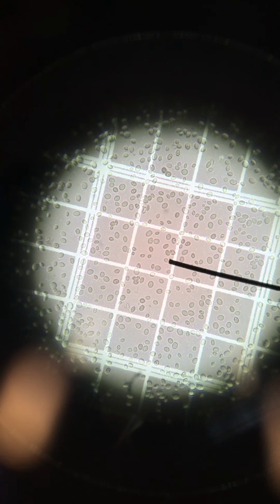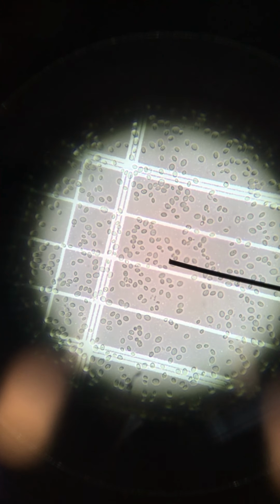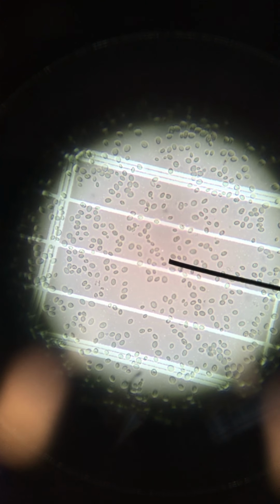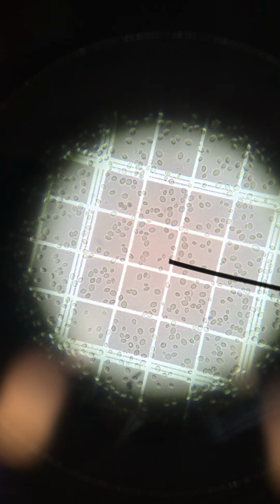So we would simply go through this cell, count up all of them, and then you would move across your field of view until you get to the opposite cell. And you can tell you've gotten to that edge because you'll get to a region where there are horizontal lines but no vertical lines. And so now I know I'm on that corner, and I'm going to go ahead and count those cells.